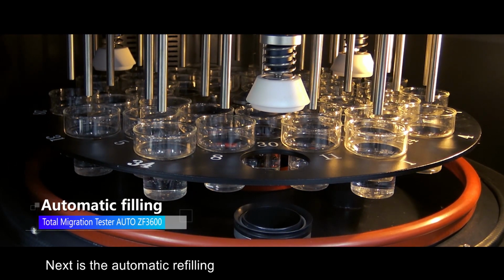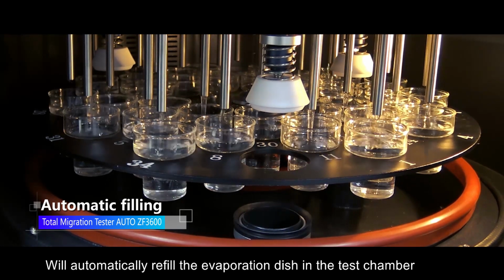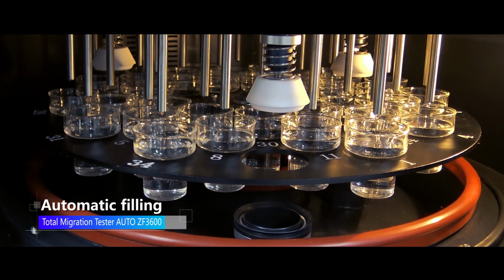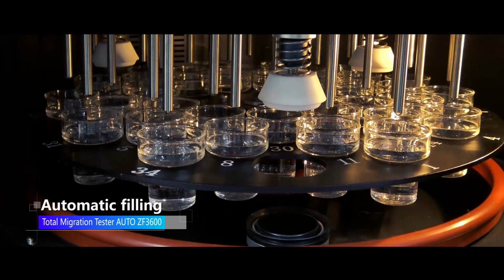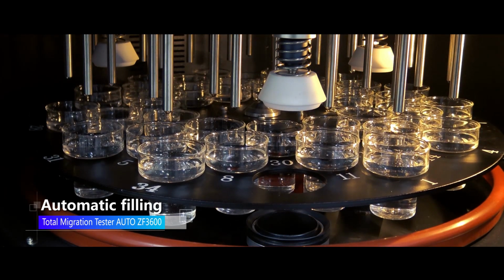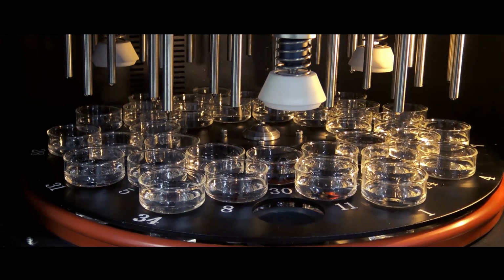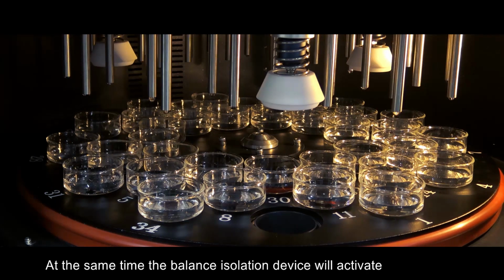Next is the automatic refilling. The automatic dosing system for solutions on top will automatically refill the evaporation dishes in the test chamber. At the same time, the balance isolation device will activate.